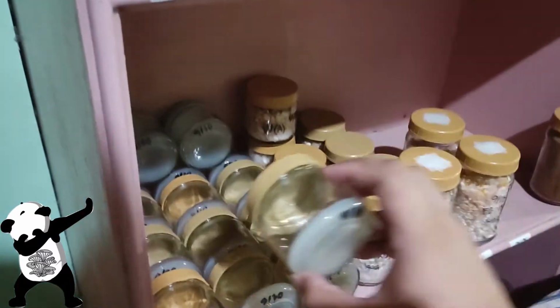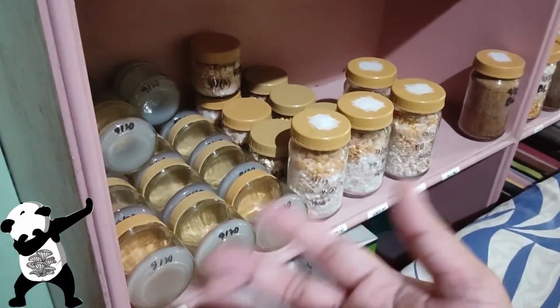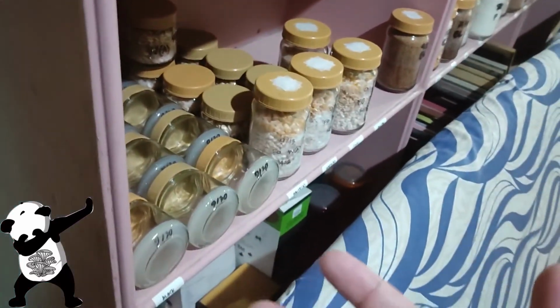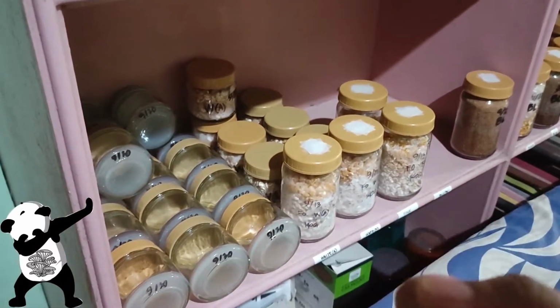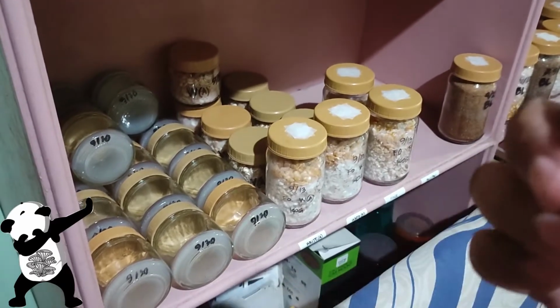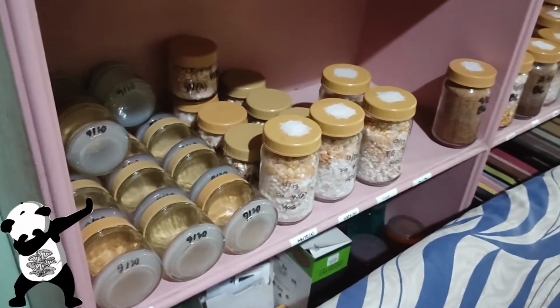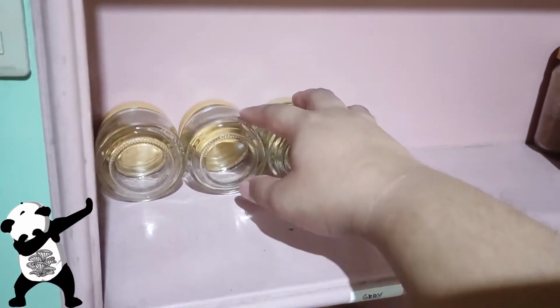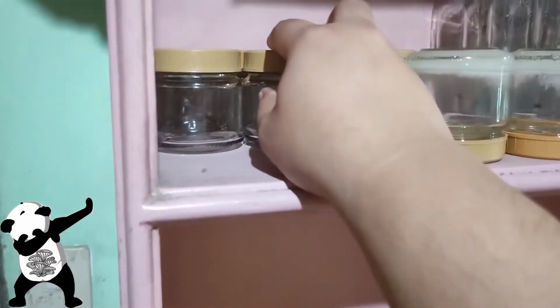Thank you very much for tuning in, and hopefully you learned something. And I think that the vinegar process actually works. So I'm still doing it every time I'm cleaning jars. I'm gonna spray some vinegar, let it sit there for at least 1 hour. But usually I'm just gonna let them sit up until I need to use them, which is like this. So I did clean them a few days back. So they did sit in a vinegar solution for at least 12 hours.